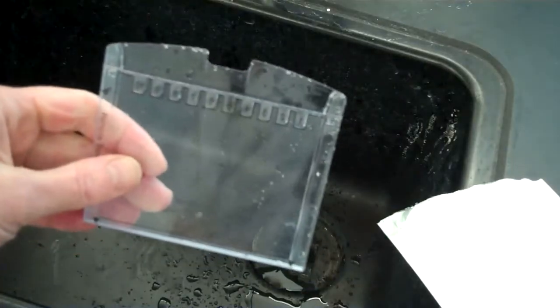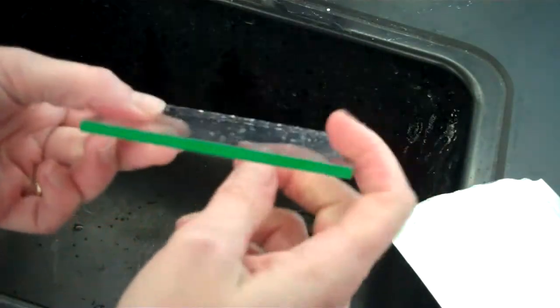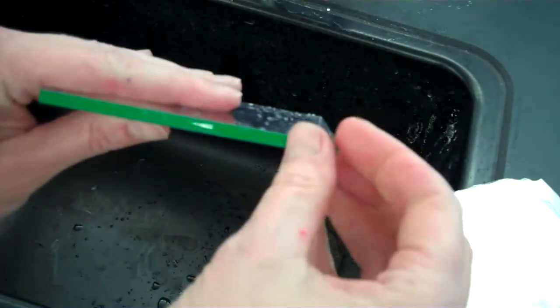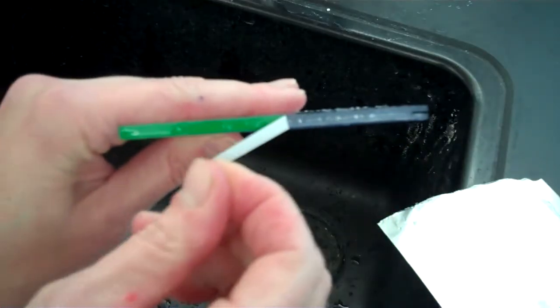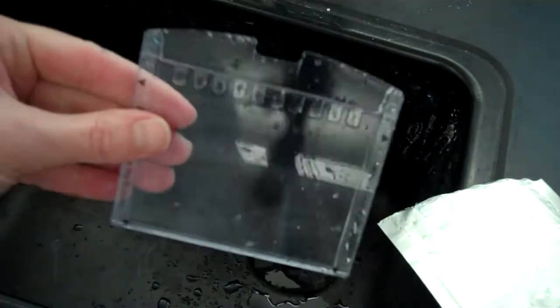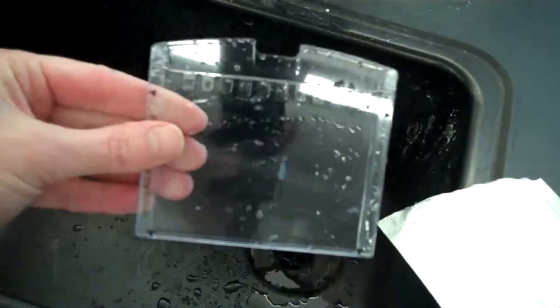Okay, so now your gel has its lanes that have been rinsed. Also, if you look at the bottom of the gel, you'll see some green tape. You need to remove this tape. And now the gel is rinsed and ready to put into the electrophoresis chamber.